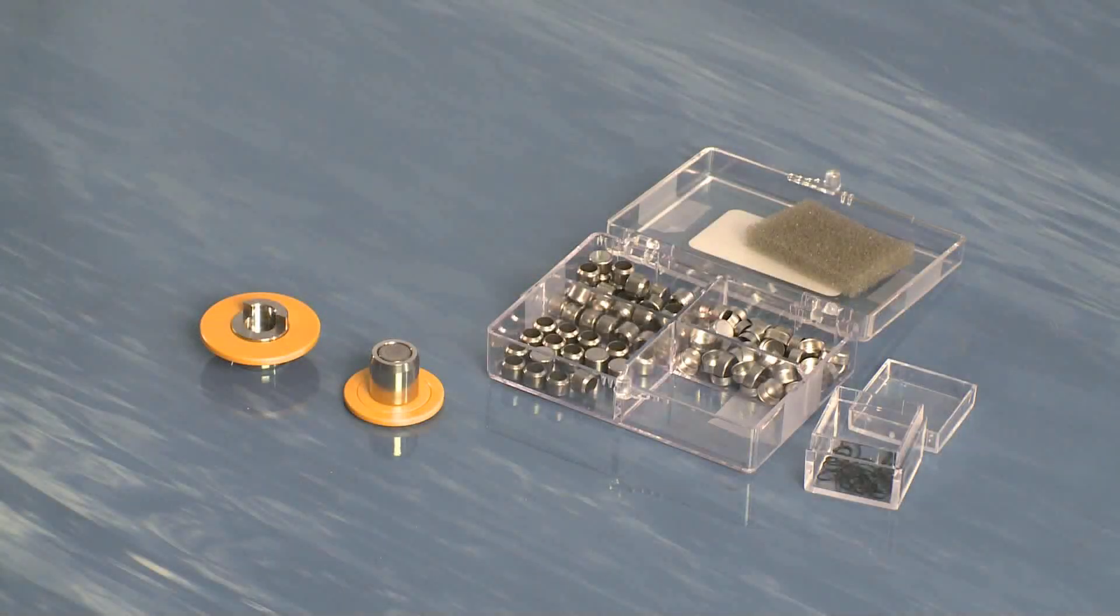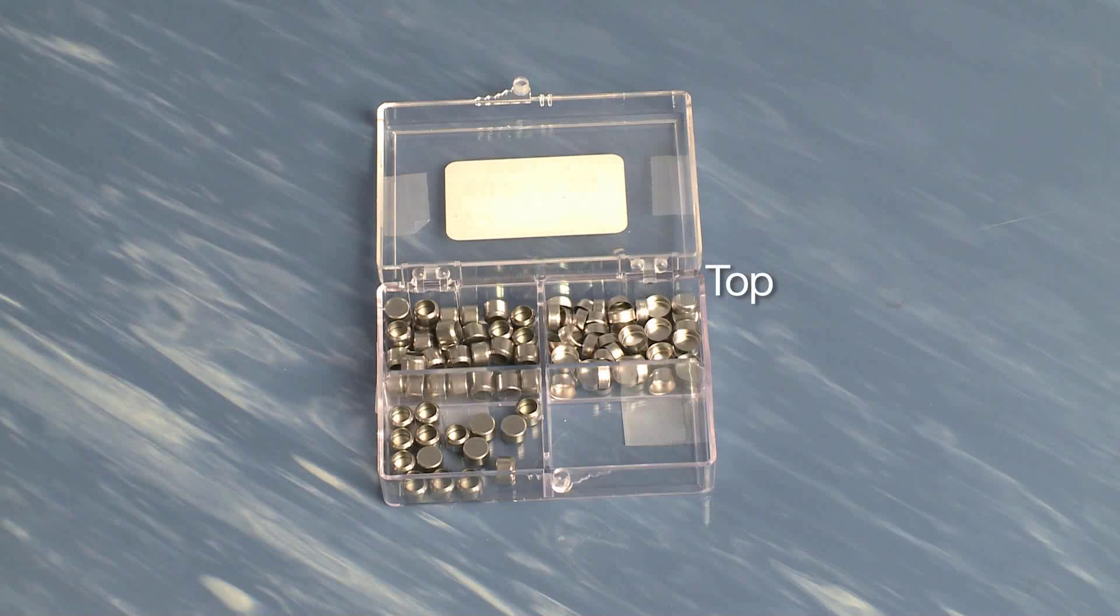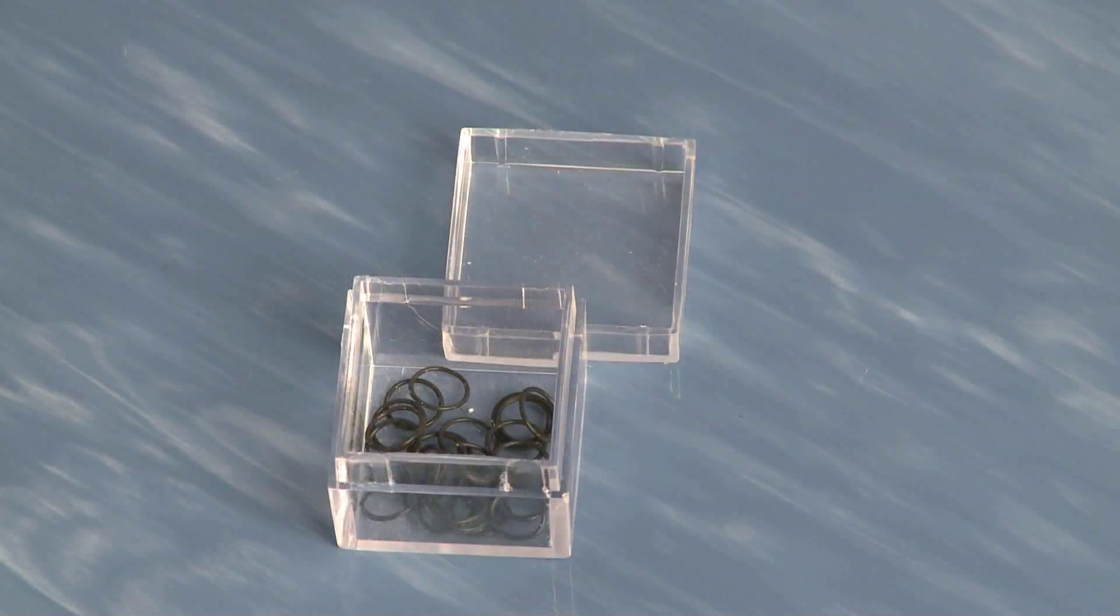These are stainless steel pans and they basically consist of three parts. The bottom part is a beveled part, the top is just a stainless steel lid, and then they also come with a Viton rubber gasket which makes the seal.